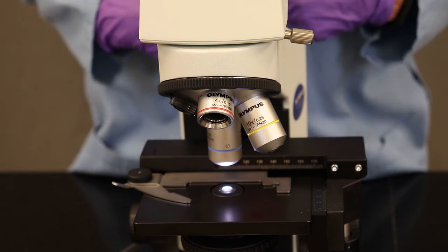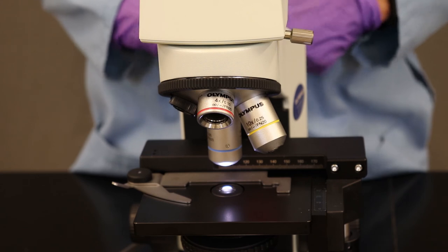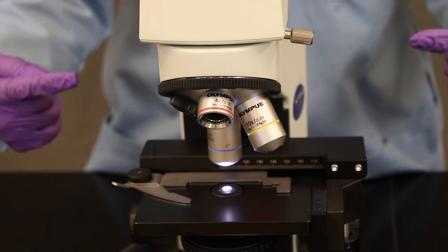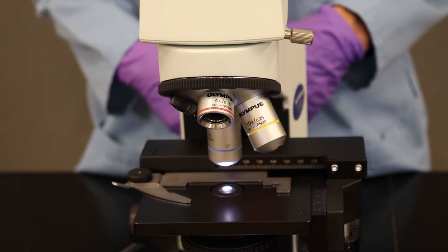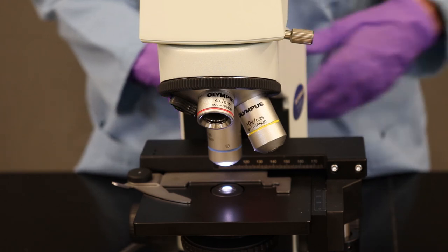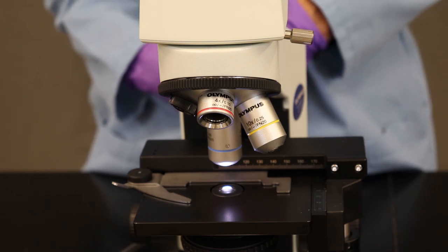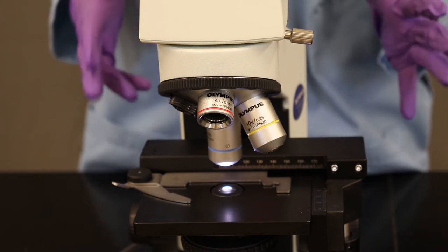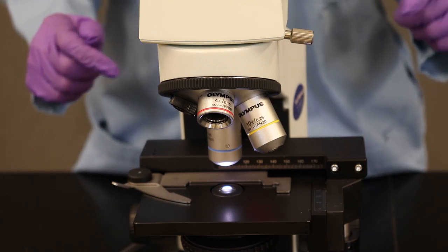Some microscopes can go even higher than that, but for what we're doing in this class we're going to stop at 40x objective, 400 total magnification. But some of the slides I'll show you in class on my PowerPoint slides will be at higher magnifications than this. I'll get into how to put a slide on and focus a slide in a minute.